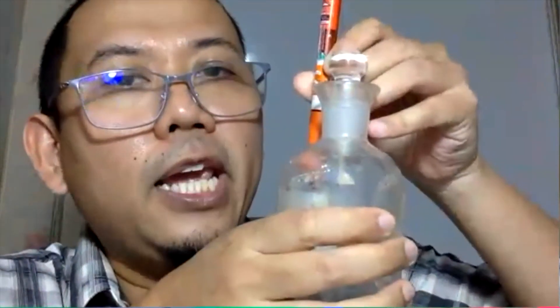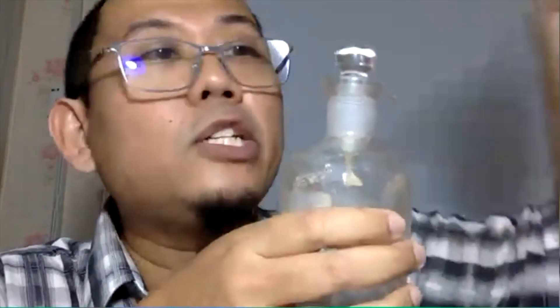But if you are doing the BOD experiment and on the zeroth day the DO is 7, then you come back at day five and the DO is recorded as zero — the BOD is not simply 7 minus 0 giving you 7 mg/L. Any reading on the fifth day below 1 mg/L, or even zero, we cannot use. Because if you get zero on day five, we never know whether zero actually occurred on day three, or even day two — you don't know when zero mg/L actually occurred.